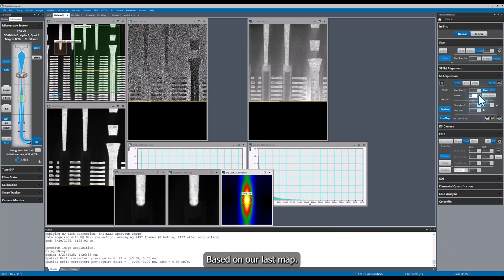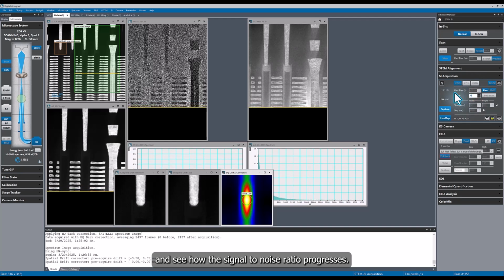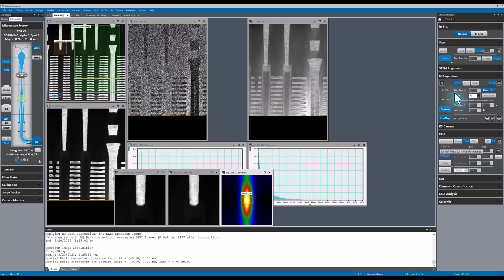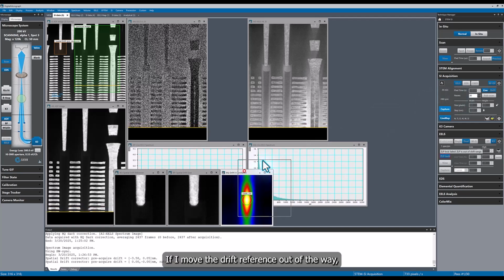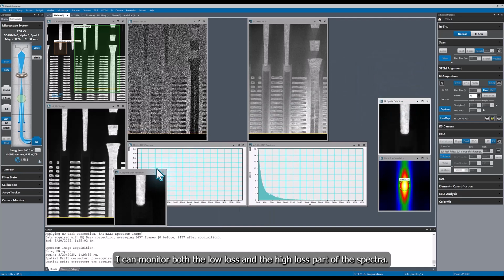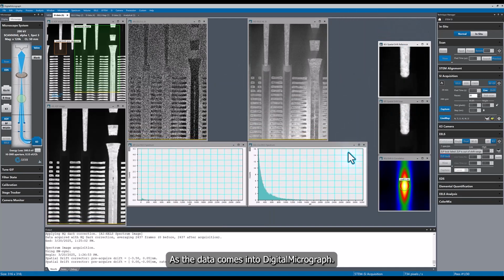Based on our last map, I'll reduce the number of passes to 30 and see how the signal-to-noise ratio progresses. If I move the drift reference out of the way, I can monitor both the low loss and the high loss part of the spectra as the data comes into Digital Micrograph.